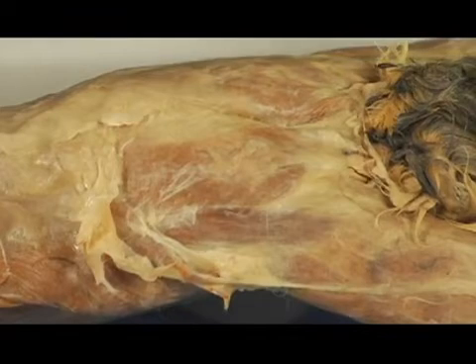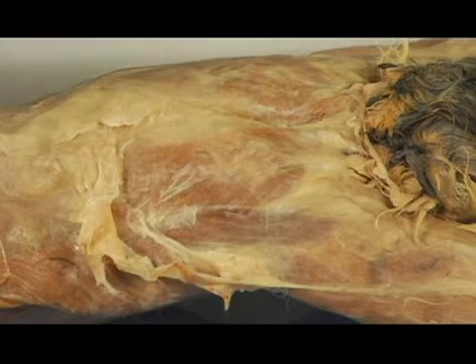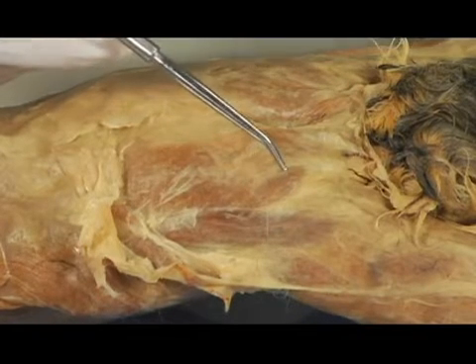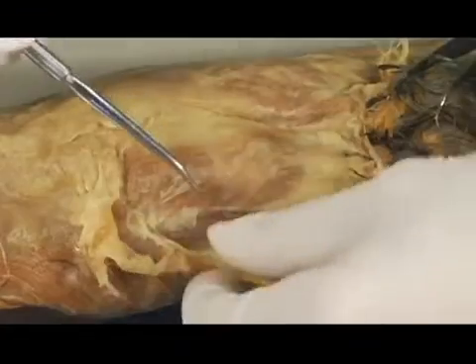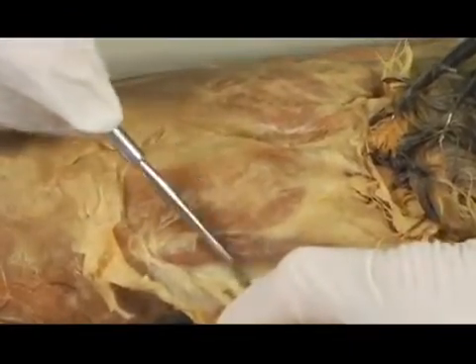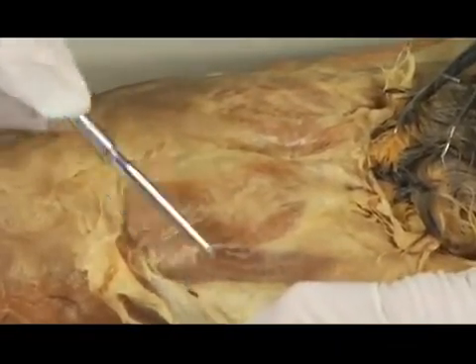Okay, I'm going to grab another tool while I'm here. I'm going to pull it over. This is one of the things I talked to you about before. It's called a blunt probe. So if you can see the blunt probe there, you can also use that to help separate some of the tissues. How do you do that? You usually pull with your thumb and then use the blunt probe to just kind of push into the tissue.